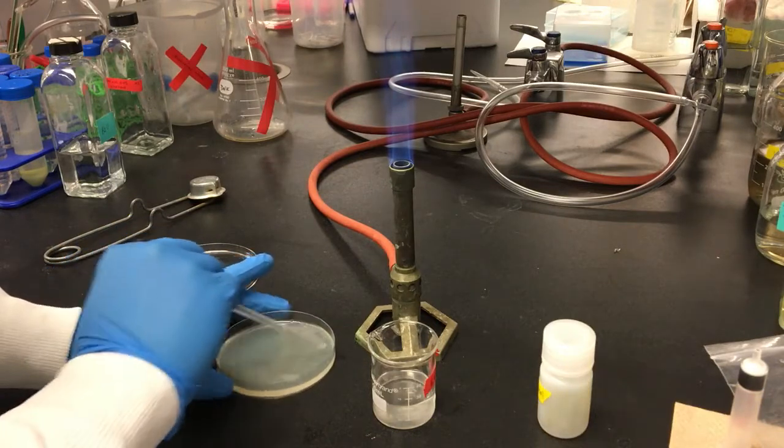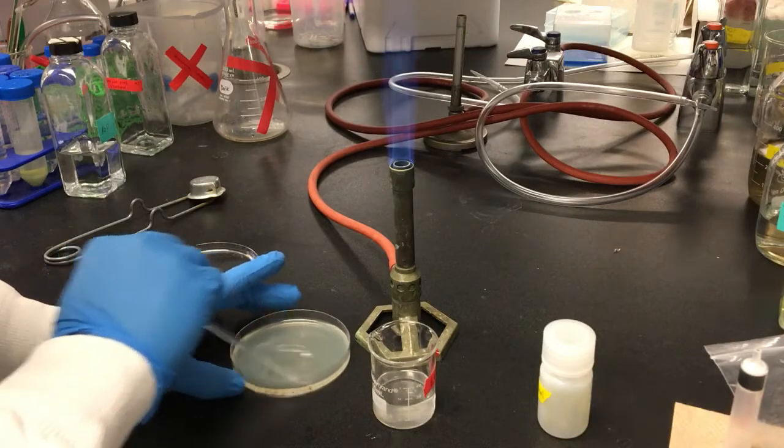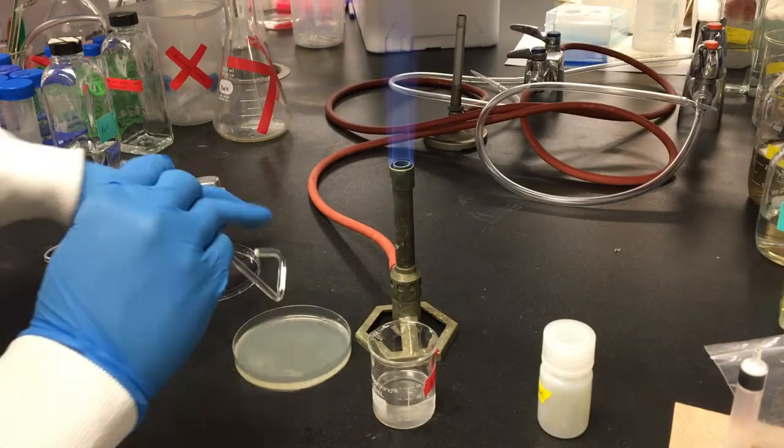I do this next to the flame so that the air current prevents particles like dust or spores from falling onto the plate.